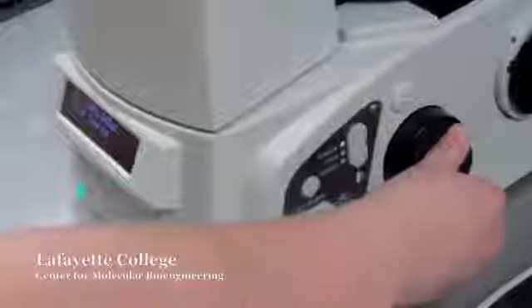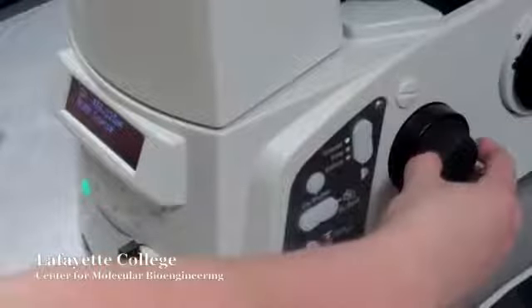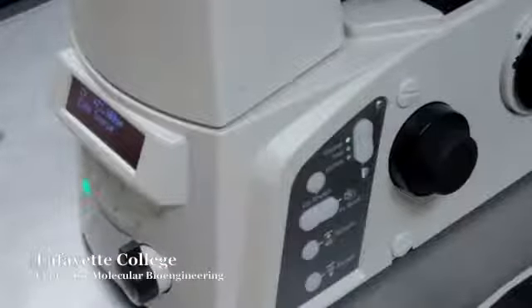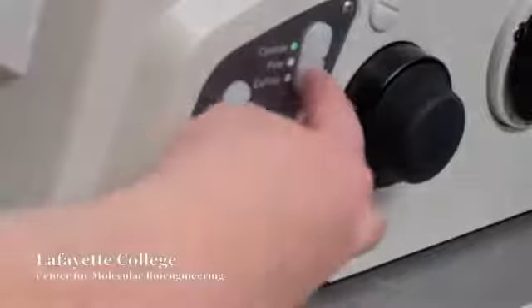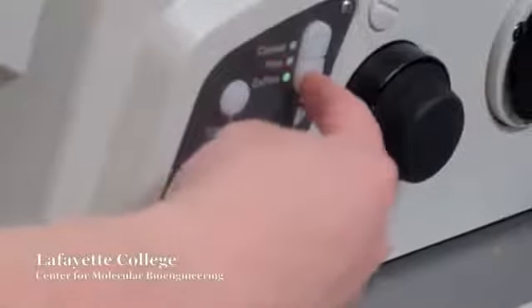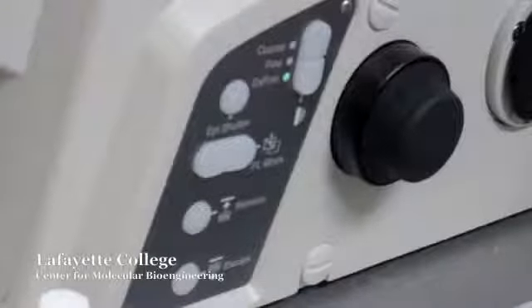Look through the eyepiece while adjusting the large knobs on either side of the confocal to focus the image in the Z direction. As the display will show you, rotating the knob towards you will raise the nose piece, while rotating the knob away will lower the nose piece. Switch between coarse, fine, and extra fine focusing using the buttons on the right or left sides of the microscope.